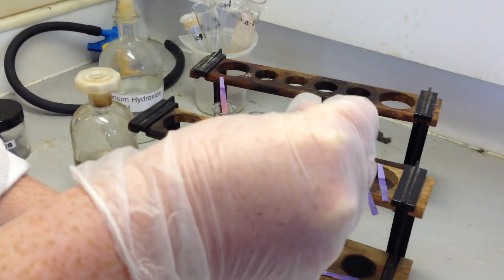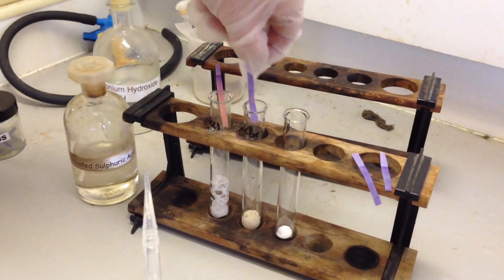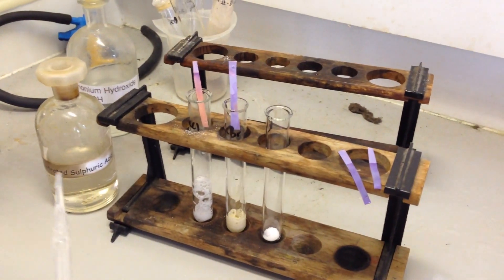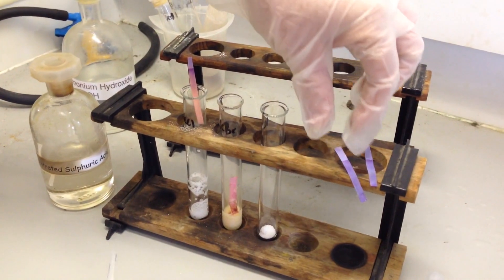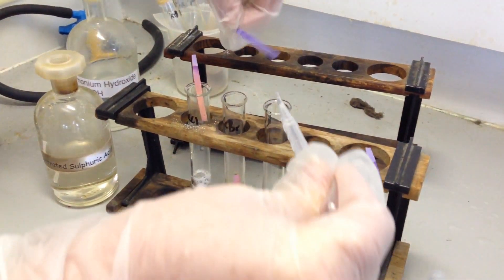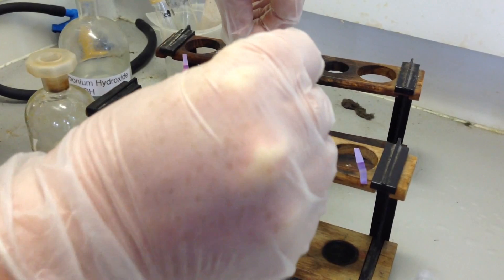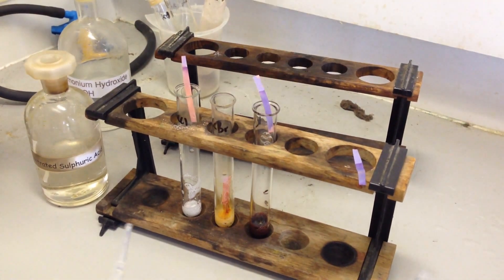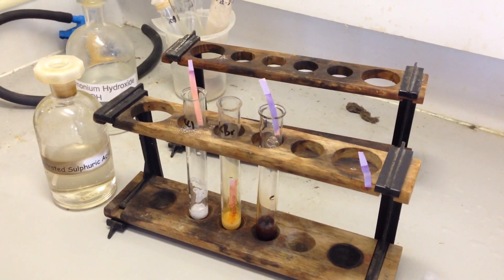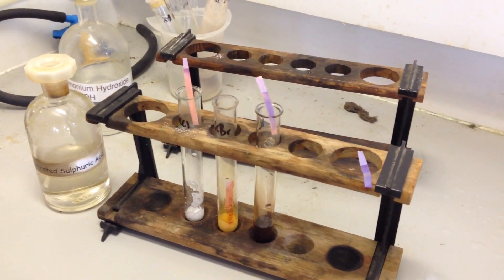You can see the litmus paper is turning red. Let's test the next one. With the bromide you can see this is fizzing away furiously — just pop the litmus paper in the top there. You can see it's fizzing away and has turned red. Potassium iodide — we can see that has gone a dark brown colour, and the litmus paper is turning red straight away. If you listen carefully you might be able to hear the hiss of the gases.